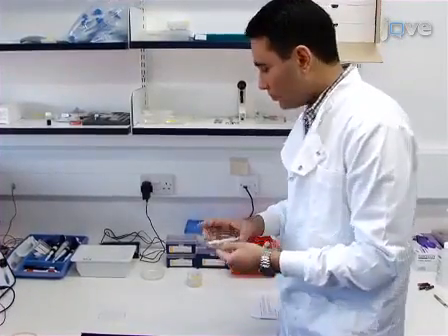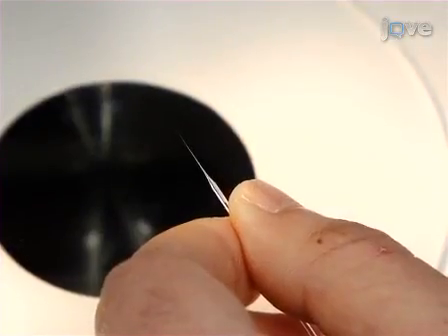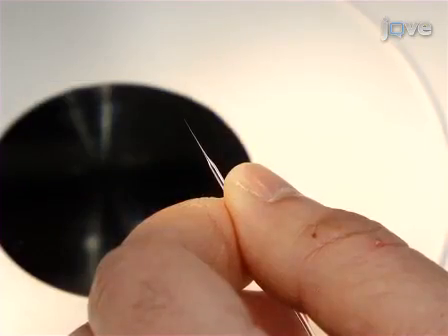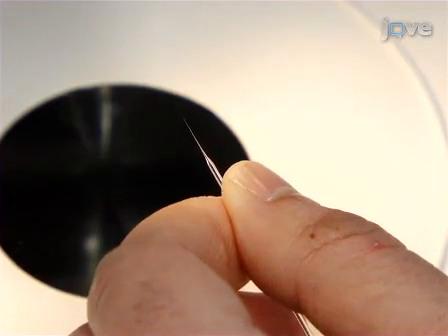Prior to electroporation of plasmids into the neural tube, glass needles were prepared using a microcapillary puller. Under a dissecting microscope, use fine forceps to break off the tip of the needle. The end of the needle should be sharp enough to pierce the neural tube while not being so narrow that it impedes injection of the DNA solution.